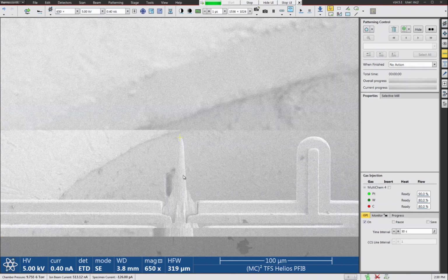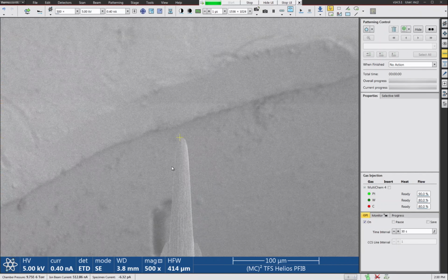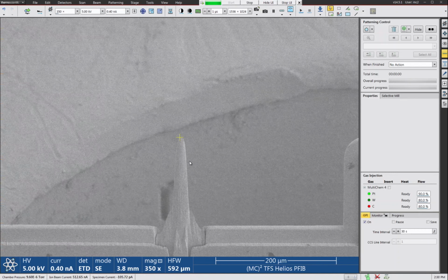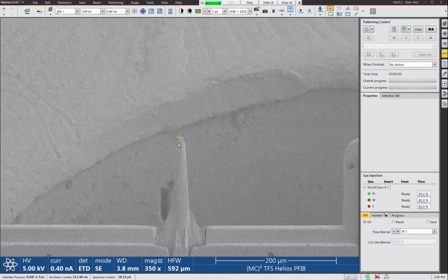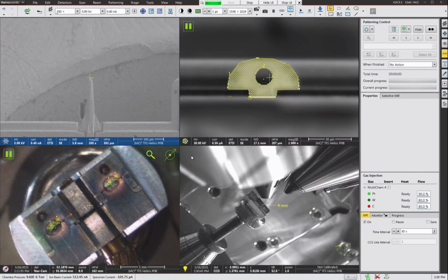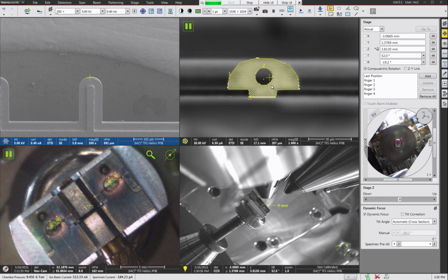All right, pretty good. So we can see here we've turned our copper TEM grid finger into something more like a post, but it's still kind of a rough shape. The top's not flat. It's way too wide in diameter. So now, when I would be doing this for real, I would move over to the next finger by going to my saved stage position, and I would just do all the cuts at this 0.5 microamp beam. And then I'll come back to the first post and do my cleanup cuts.